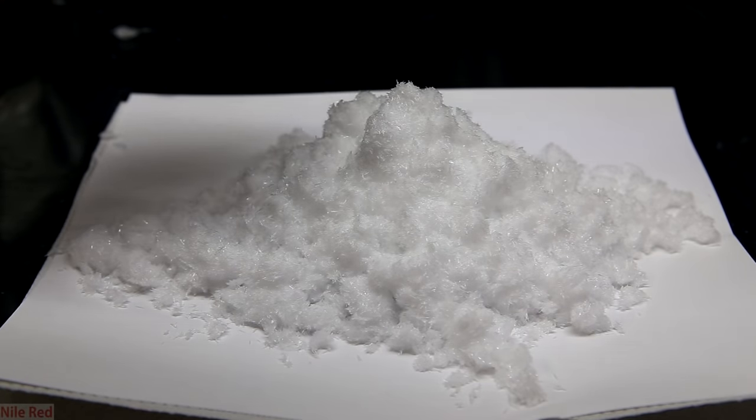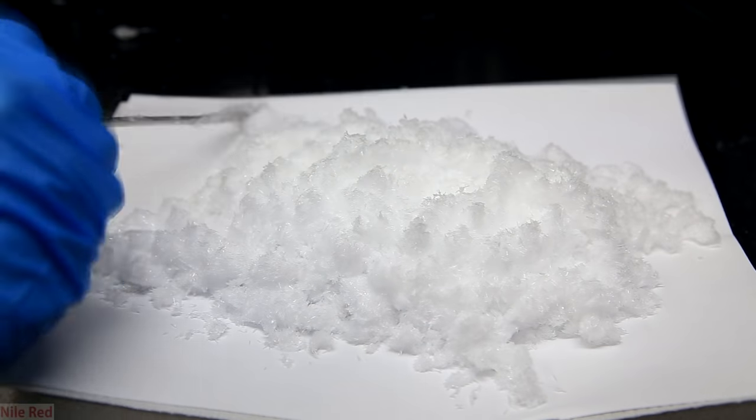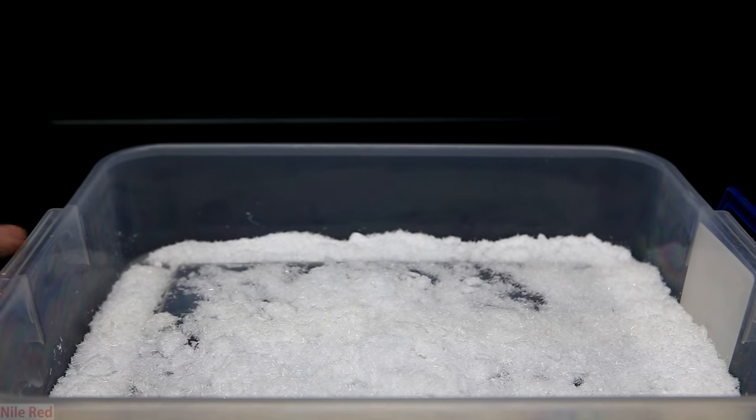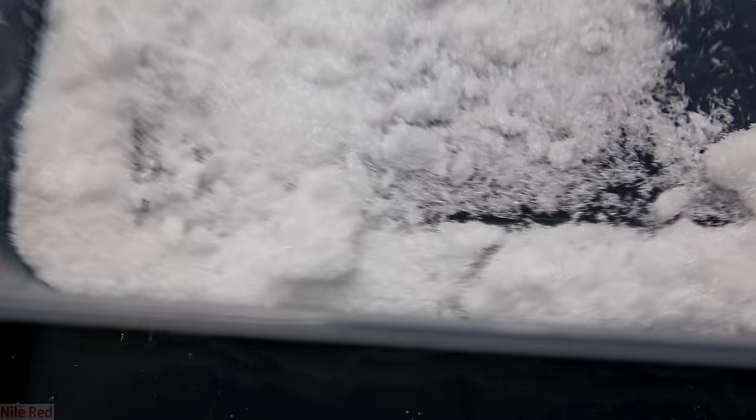To get rid of the ethanol, it's very simple and we just have to leave it out to dry in air. To dry it, I spread all the crystals out in a small container. After leaving it out for just one night, the crystals were pretty much dry.